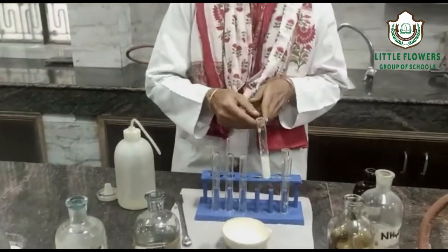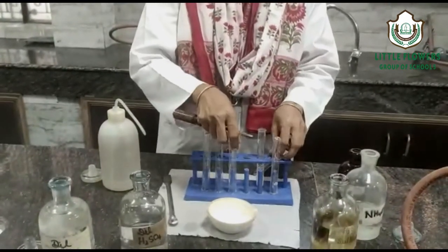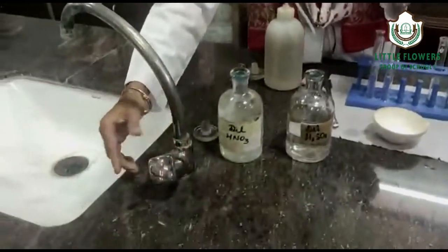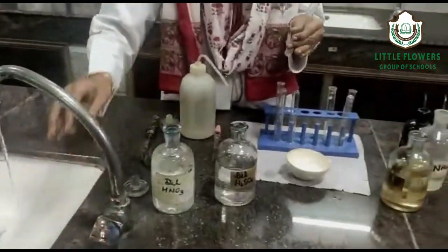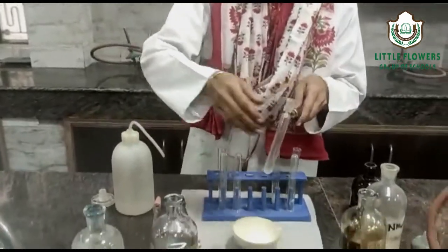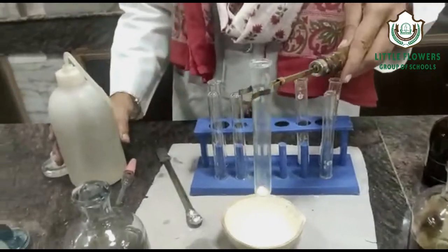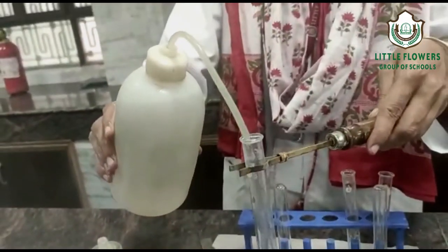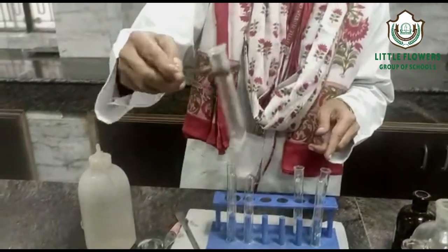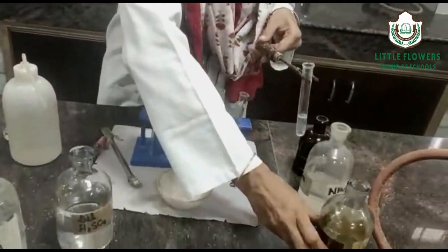Now we do the confirmatory test for the chloride radical. Whenever you use concentrated sulphuric acid, you should be very careful. Again, in a test tube, take the salt and prepare an aqueous solution. The salt dissolves properly, confirming it is soluble in water.